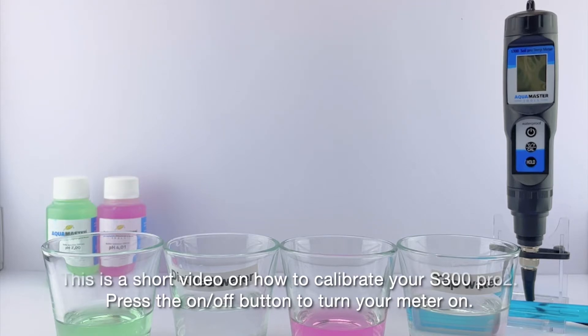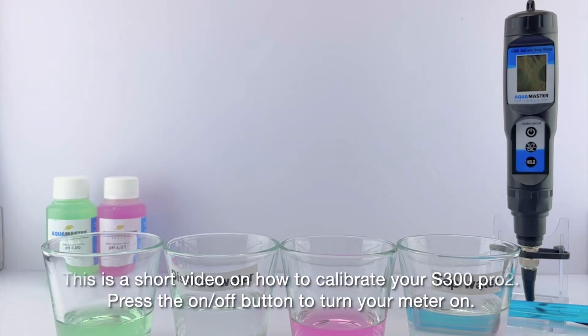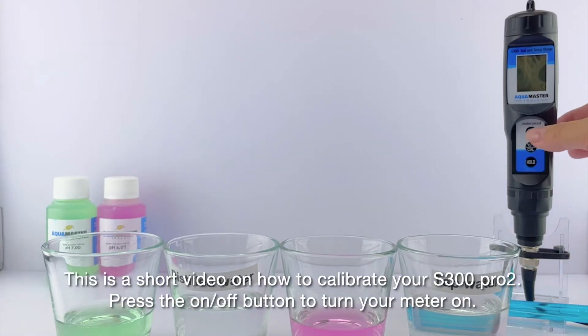This is a short video on how to calibrate your S300 Pro 2. Press the on/off button to turn your meter on.